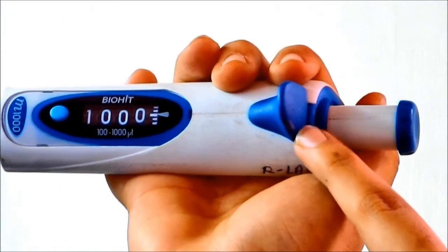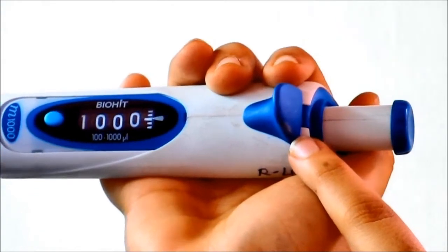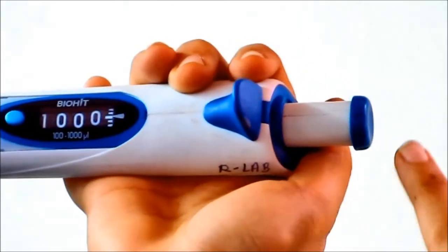The last part is the volume adjustment knob which can be rotated to adjust the volume of the liquid as well as eject the liquid.